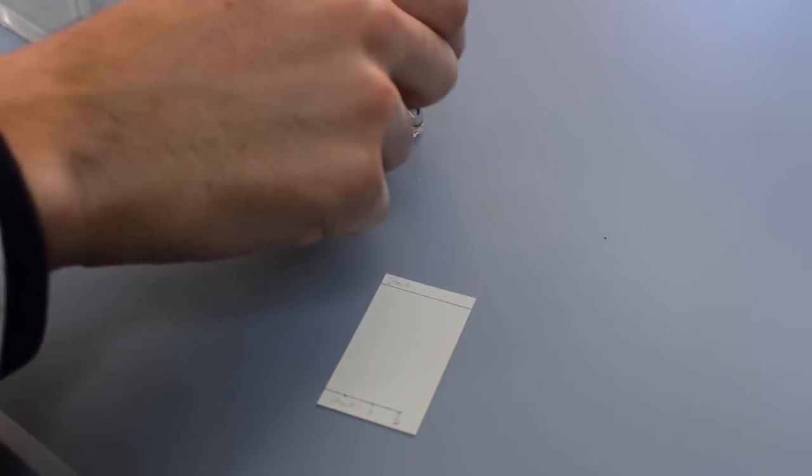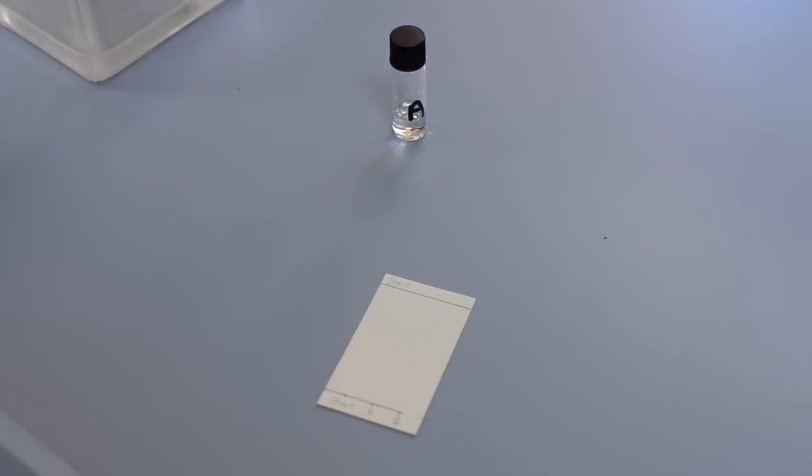Take samples of your pure reagent mixtures and dilute with ether or dichloromethane and keep them in small labeled resealable vials.